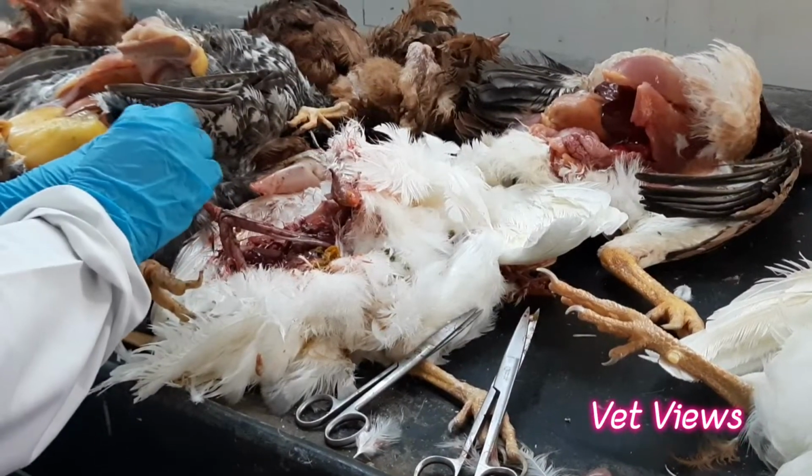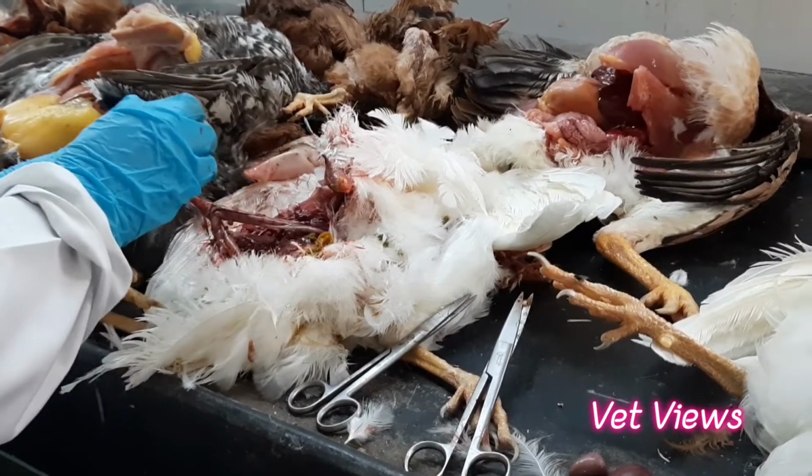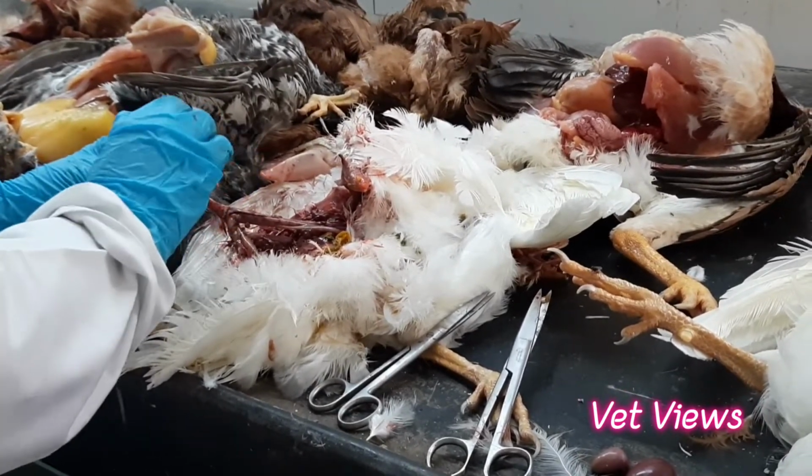This is the glands. That also indicates mucosal changes only. The hexagonal structures are the papillae, so that is a structure we are able to see.